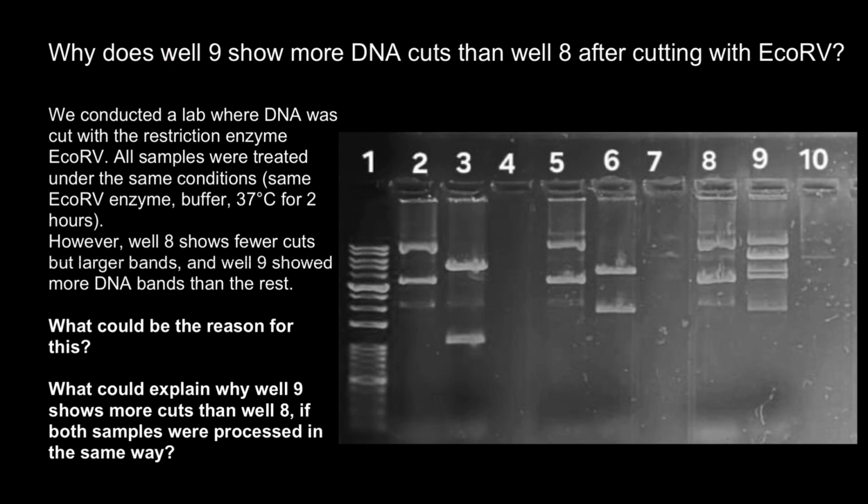Why does well 9, which is here as you see, show more DNA cuts than well 8, which is next to it, after cutting with EcoRV? And here's the question. We conducted a lab where DNA was cut with the restriction enzyme EcoRV. All samples were treated under the same conditions: same EcoRV enzyme, buffer, at 37 degrees Celsius for 2 hours. However, well 8 shows fewer cuts but larger bands, and well 9 shows more DNA bands than the rest. What could be the reason for this?